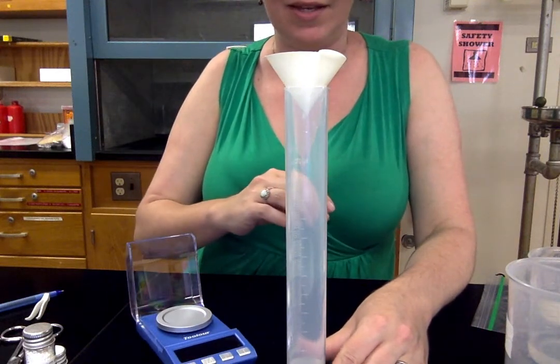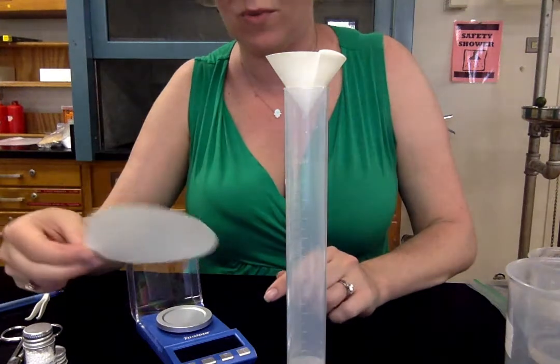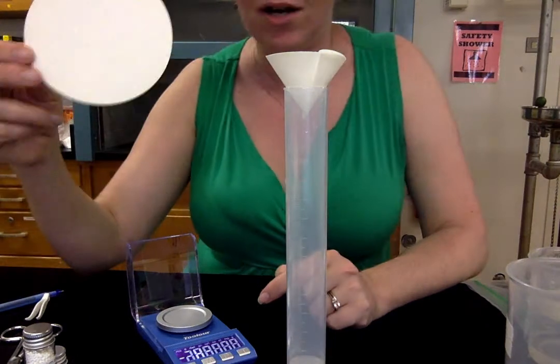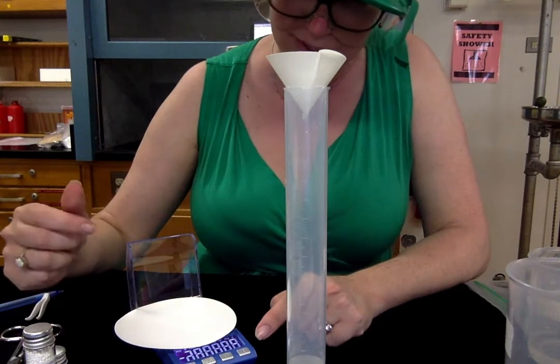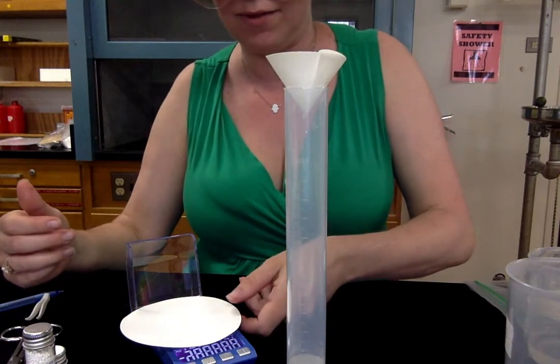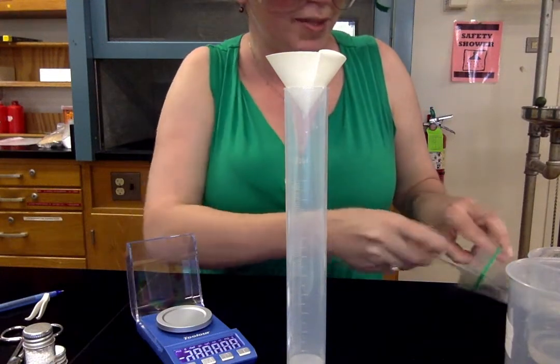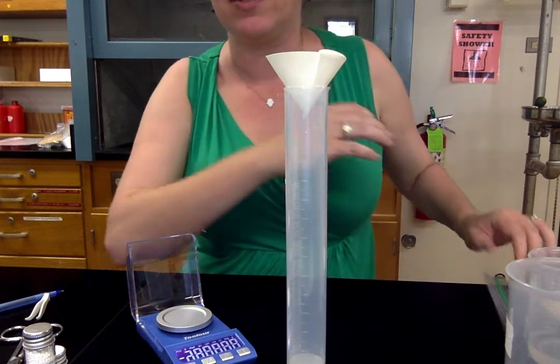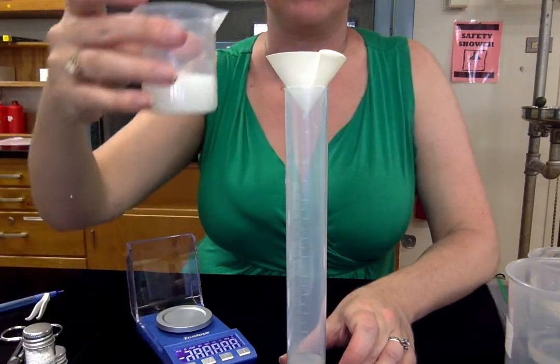I suppose if you forgot like me in a pinch, this is poor technique, you could just weigh a different piece of filter paper and call that the weight of the empty filter paper. All filter papers are not created exactly equal. So they all have slightly different masses. So it's important to really get the mass of the one you actually used. But in this case, I could use my second filter paper in a pinch to take a mass of the empty filter paper because our precipitate is going to stick to the filter paper. We don't want to try to scrape it off. We would lose a significant amount if we did it that way. So we are going to weigh it on the filter paper at the end.